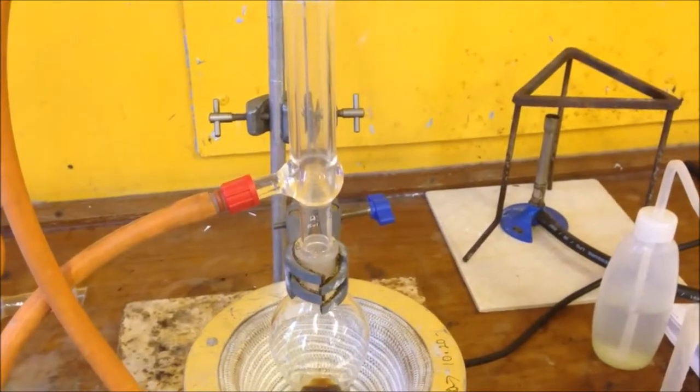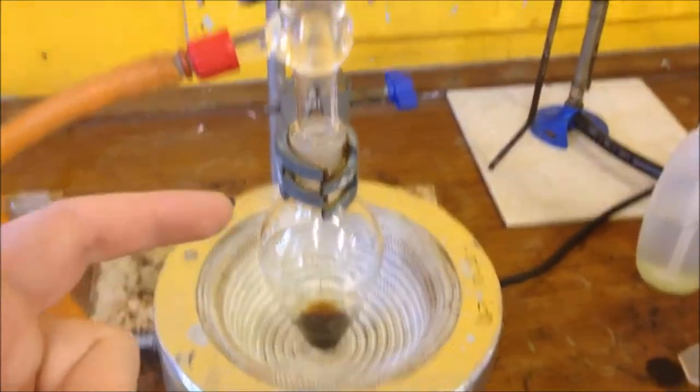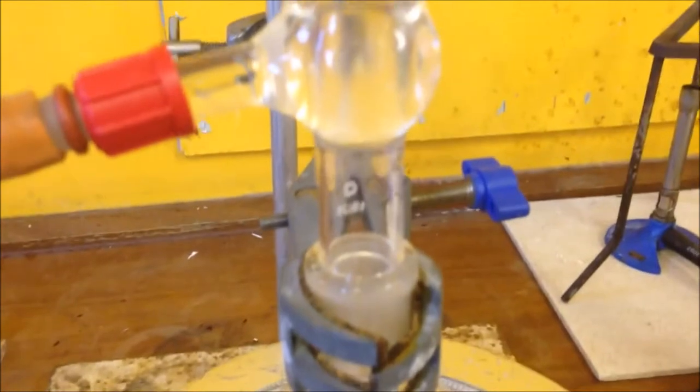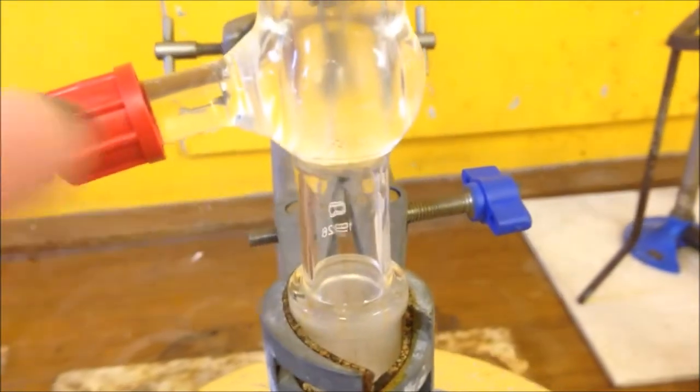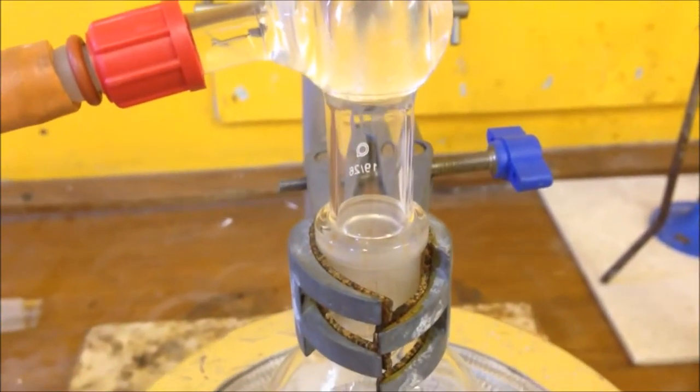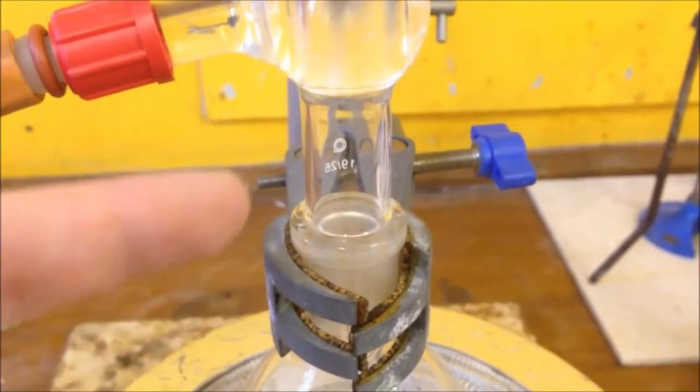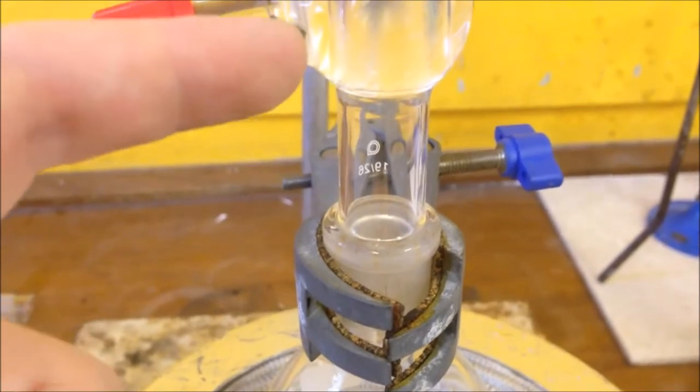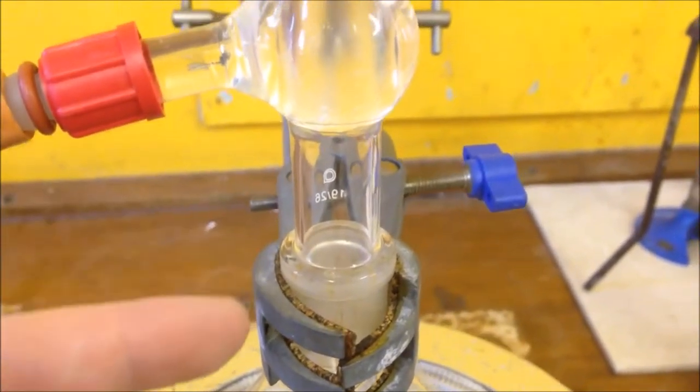So here we're making aspirin under reflux. You can see it's bubbling away. I just want to bring your attention to what's happening in here. We have cold water coming in and the contents in the flask are evaporating, then condensing, and dripping back down again.